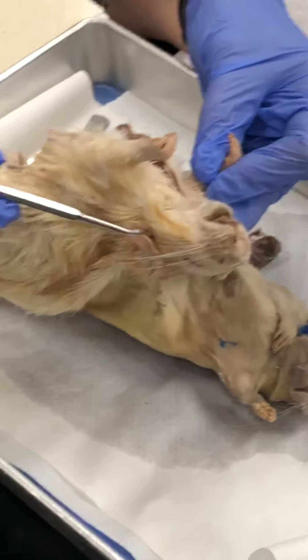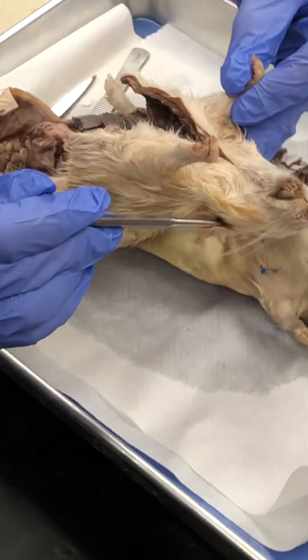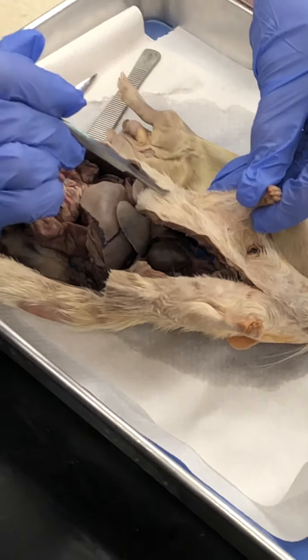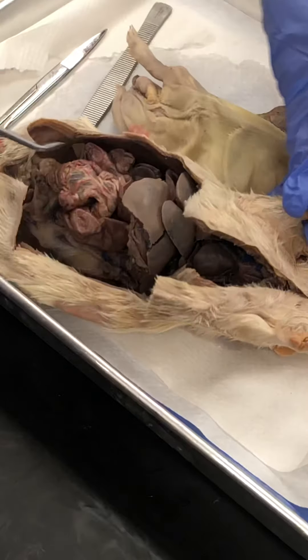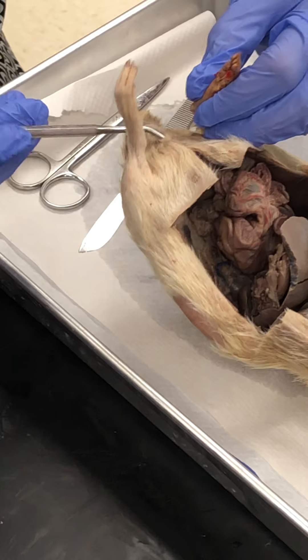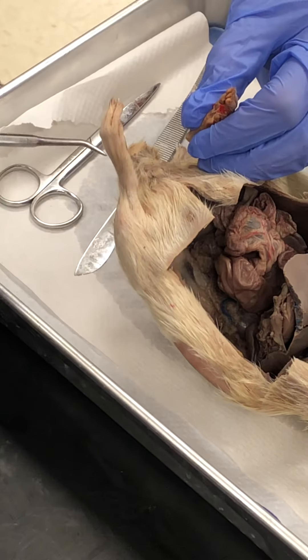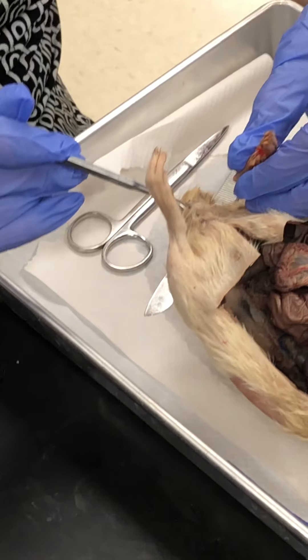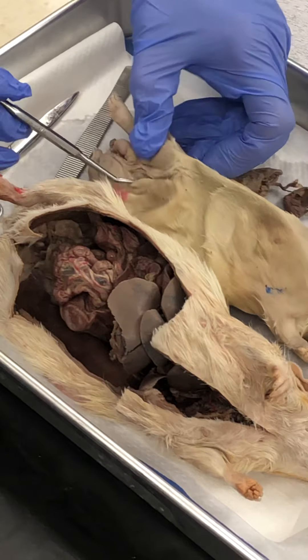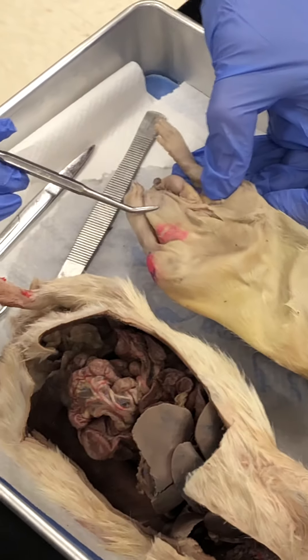This is the pinna. This is the external auditory meatus, the opening of the tube in there, and this is the nipple. Then in the female, this is the urinary meatus or the urethra. This is the vaginal orifice or the vagina, and this is the anus. Then in the male, this is the penis and this is the scrotum.